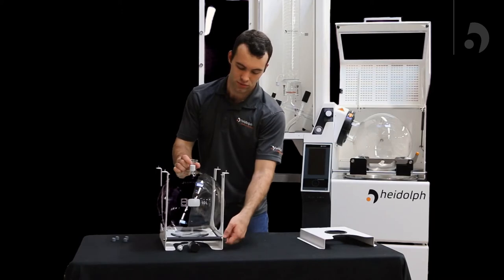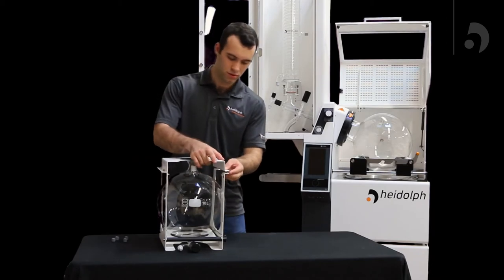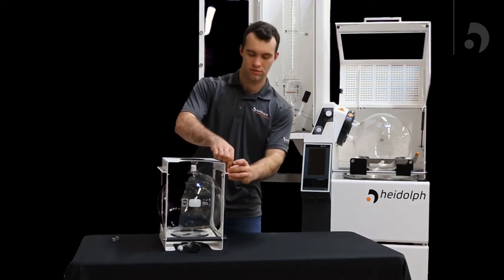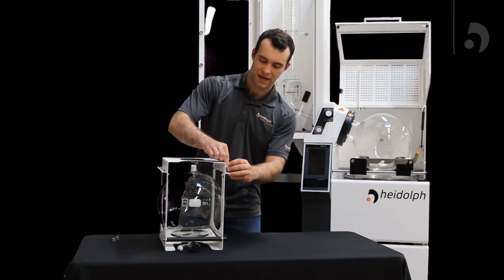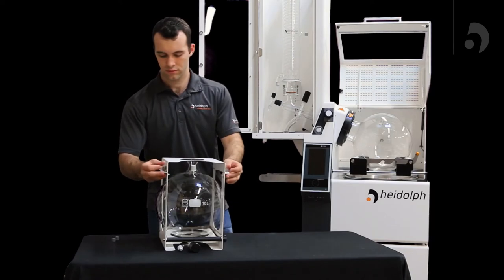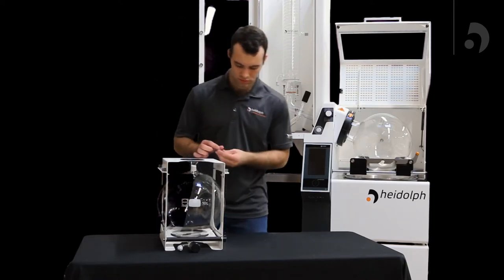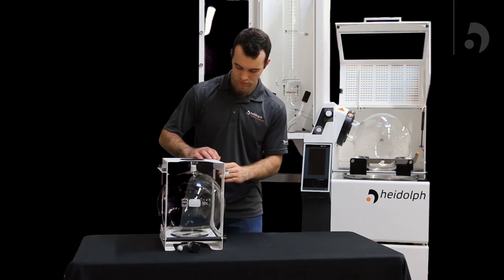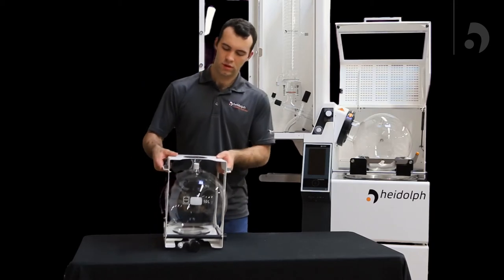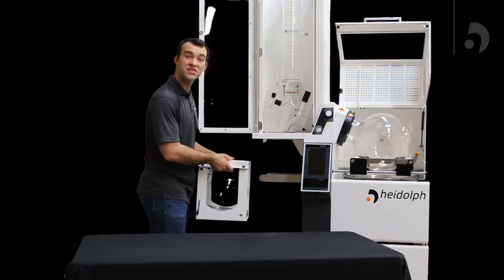We can now tighten the screw and reattach the top of the cassette using the screws. Now you can pick up your cassette and slide it over the guide rails on the side of your unit.